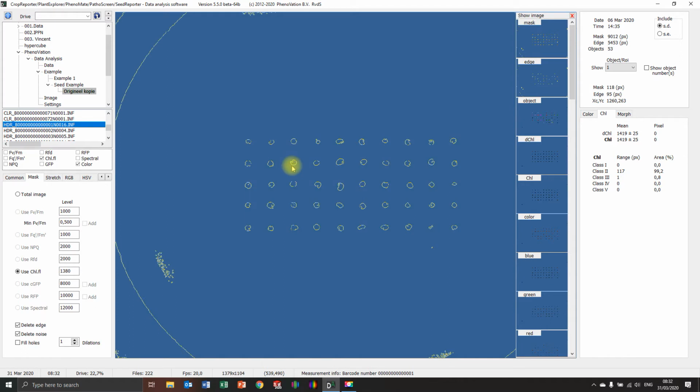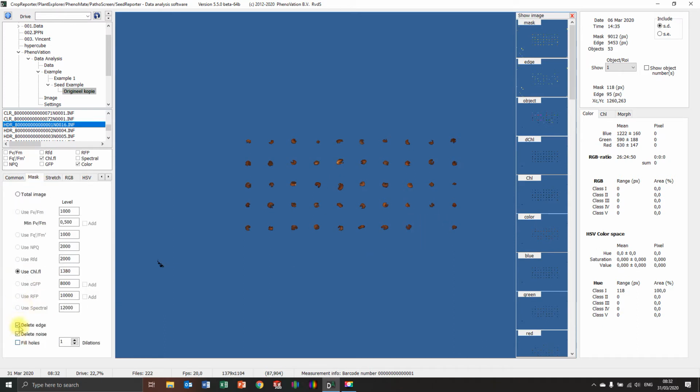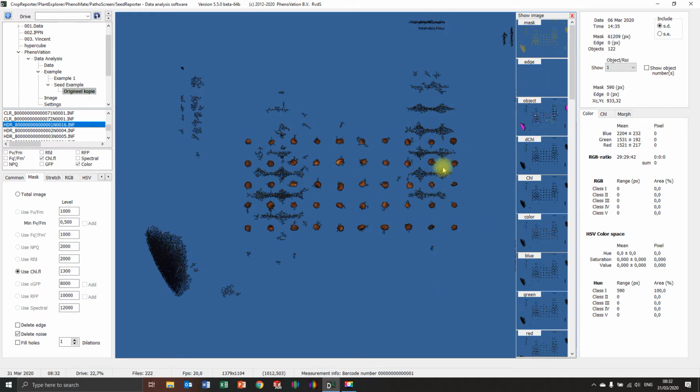The edge will cut out the excess pixels around the seeds, but you can see also seeds are disappearing. So I will switch that back off. Look, there it's back again. I want to go as low as possible so I see the most seeds. But now at 1300, you get a lot of noise. So I have to take a look at what's the perfect setting for this batch.